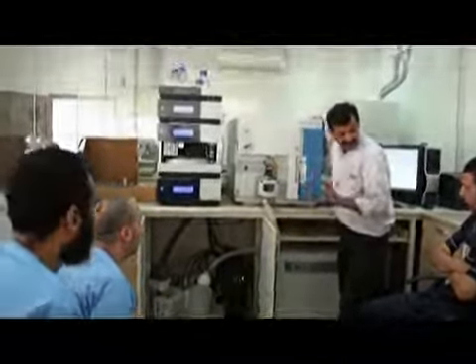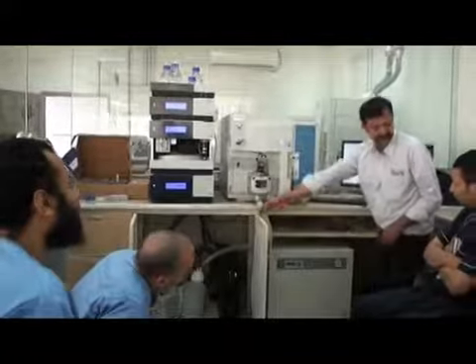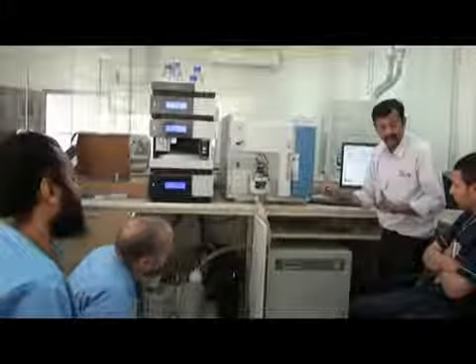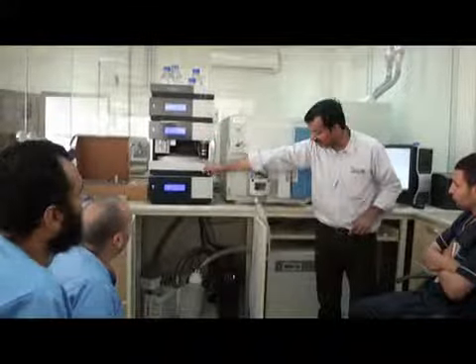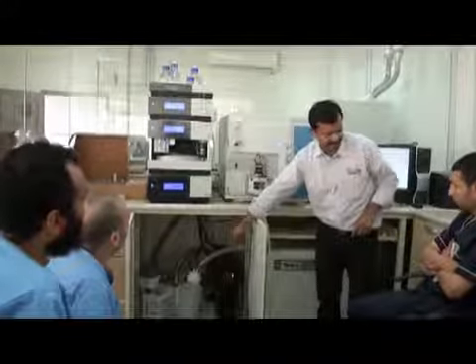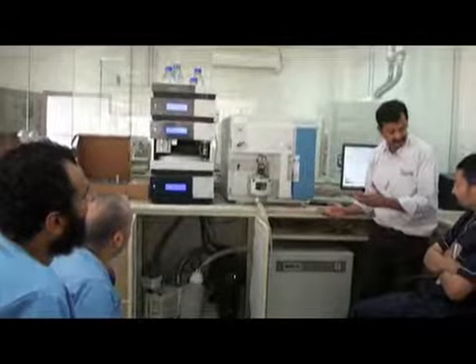Remember, when I came here, it was filled with this liquid. This liquid waste was inside this one. It is totally wrong. Not the HPLC liquid. Don't put it here, please. This is only for MS because it will give you contamination. Okay.